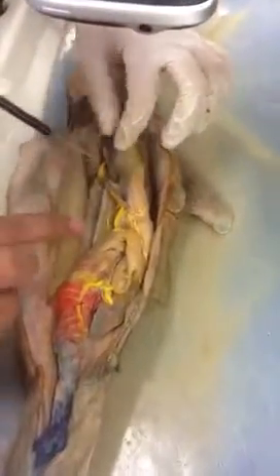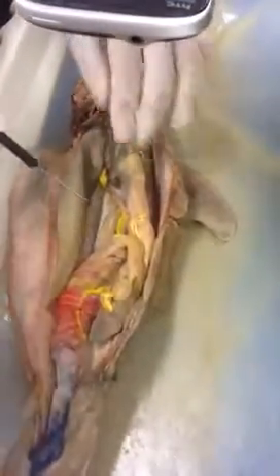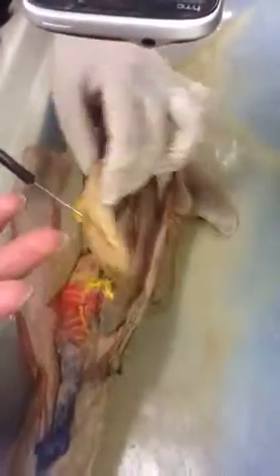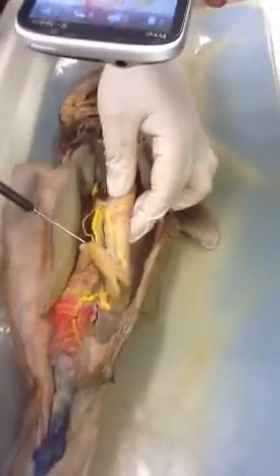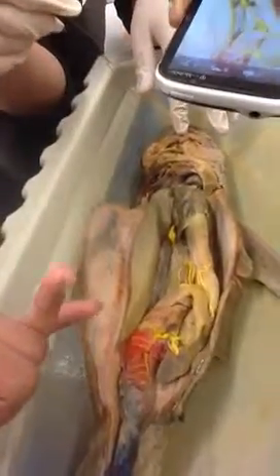And then the other branch, the pancreatico-mesenteric, branches four ways. It's your anterior intestinal arteries, your pyloric arteries, duodenal, and what's your fourth one? Intraintestinal arteries, which go into the intestines. If you're looking, that one right there running on the edge is your anterior intestinal artery.